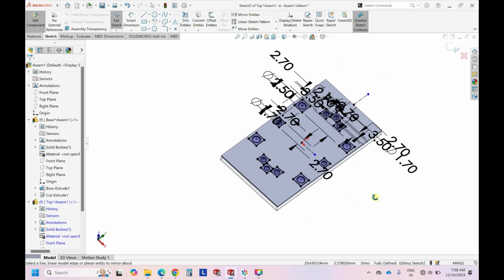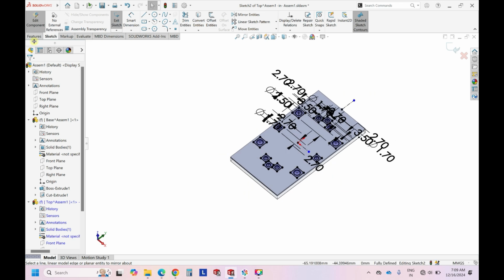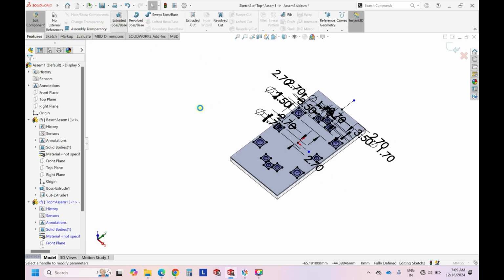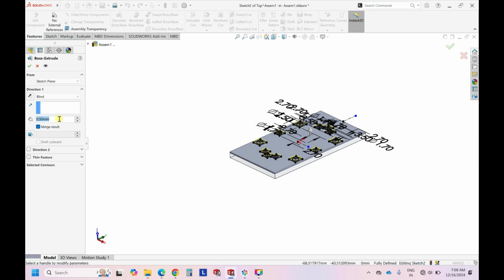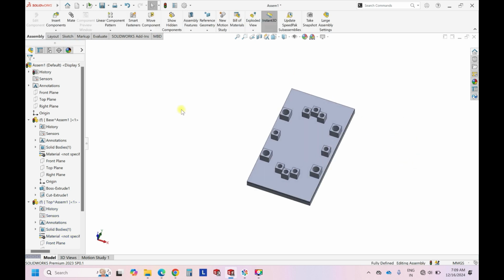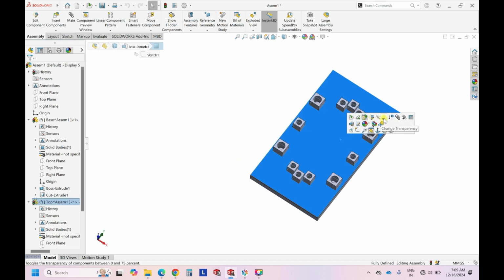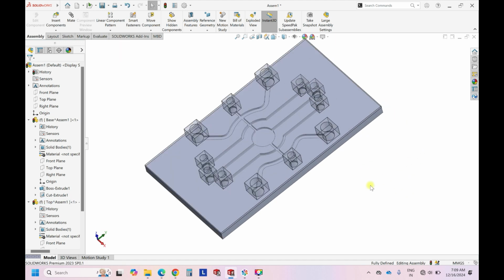Now if you see, all the connections that we want are ready, and then go to features. Now extrude them to a height of 3 mm or 2 mm depending on the tube that you're using. Generally for silicone tubing or PTFE tubing we prefer 3 mm. Click OK. Now it is ready. Once I edit the component, this is how it looks. Internally, this is how the final design looks.